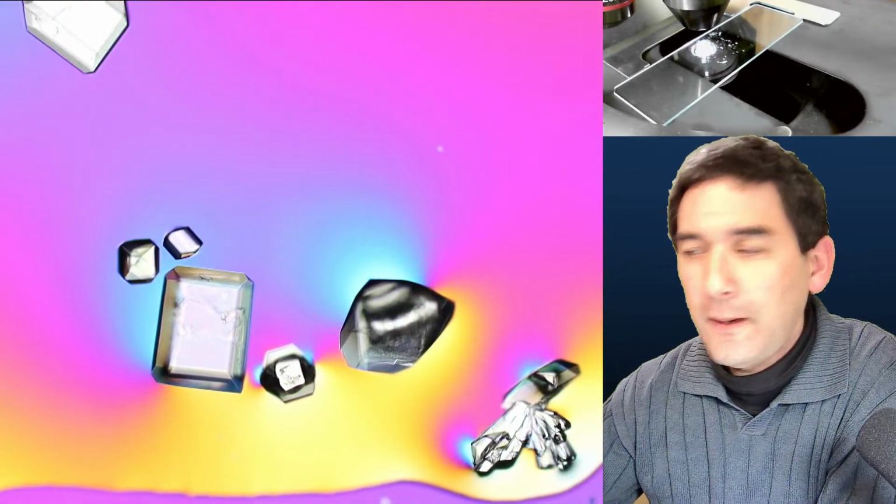Okay, so you know what? Because there was a question here, I'm just going to put some of this potassium carbonate also under the microscope now, just so that you can see how it looks. Because of the bubbles, you can actually see the dissolving process. So that's the potassium carbonate. Where is my spatula? I misplaced it again. Oh, here it is. I had it in the water. So let me dry this again a little bit.